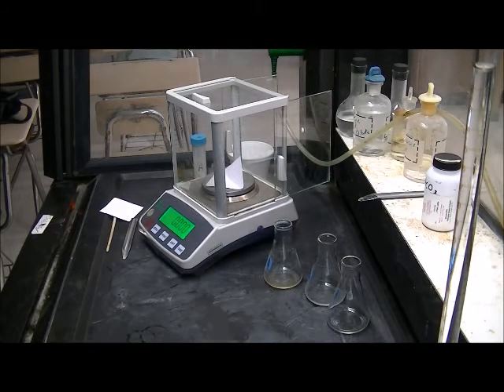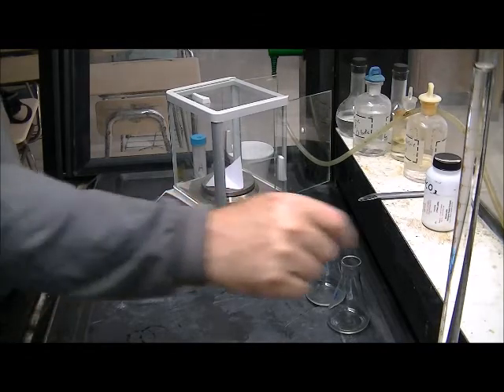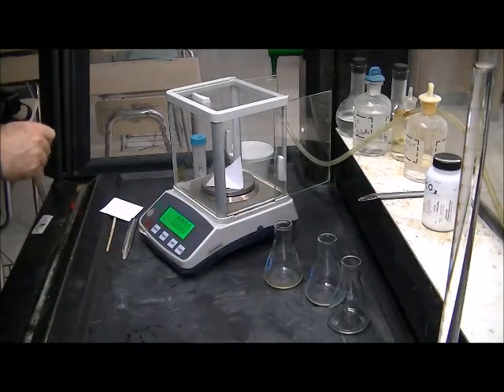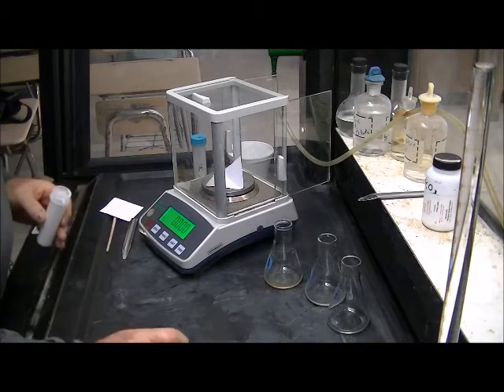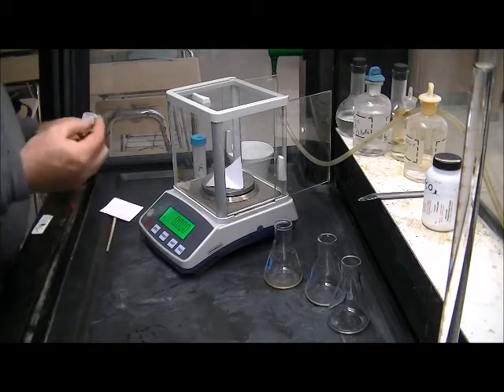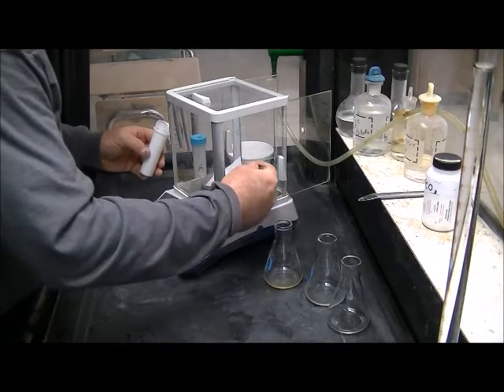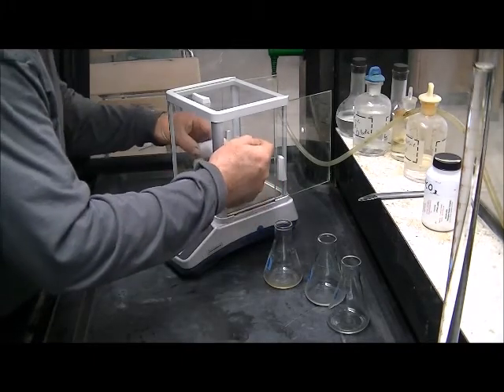So the weighing for sample B, C, and D is going to proceed very similar to what we did for sample A. In fact, the same way. And so I'm just going to do some more cutting here on the video so you don't have to watch every single step of it.